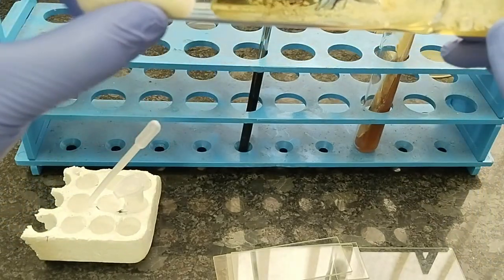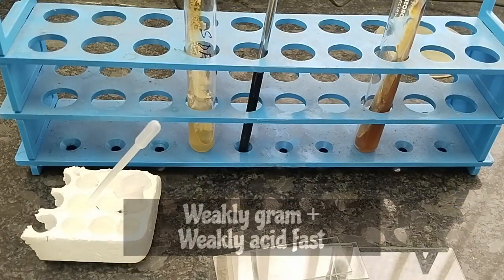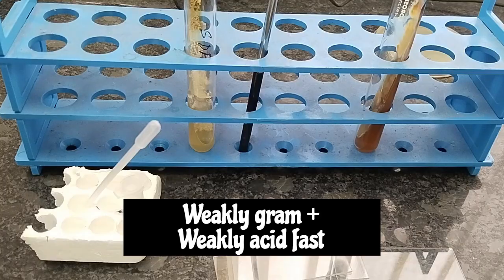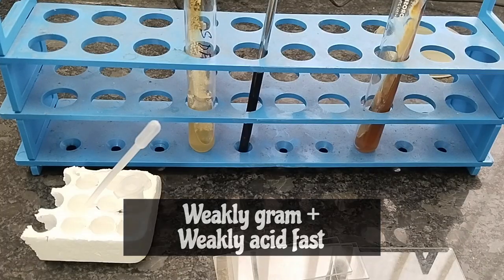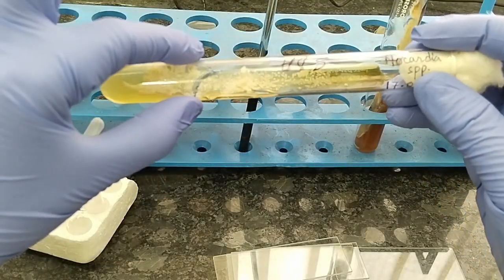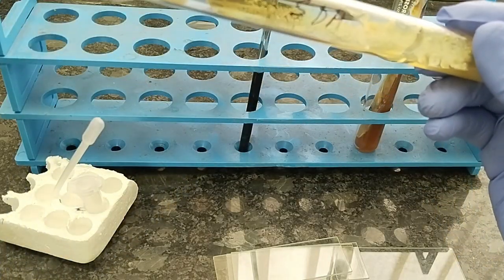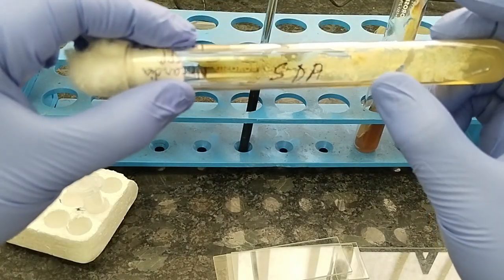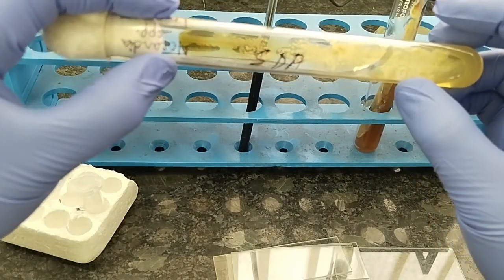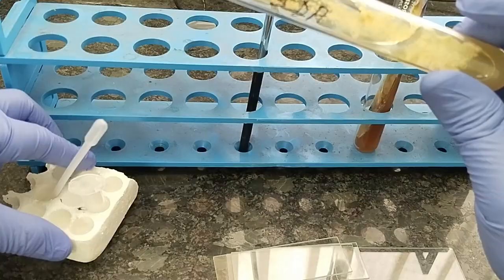So this Nocardia is weakly gram positive. It is a weakly gram positive bacteria, or the bacteria cannot be properly stained with gram stain. But it is weakly acid fast. For the demonstration purpose under microscope, we have to stain the smear of the bacteria that is made from this type of colony. It can be demonstrated by modified acid fast staining or modified Ziehl-Neelsen staining.